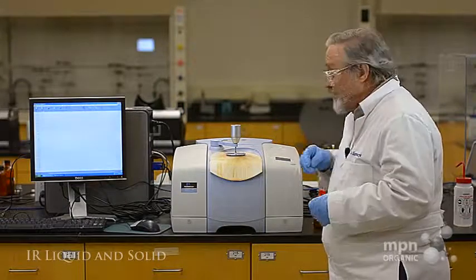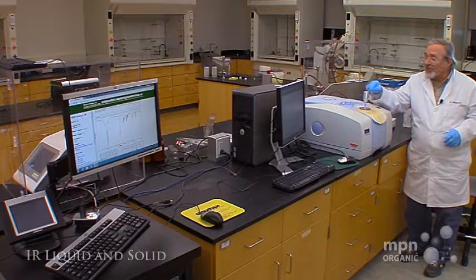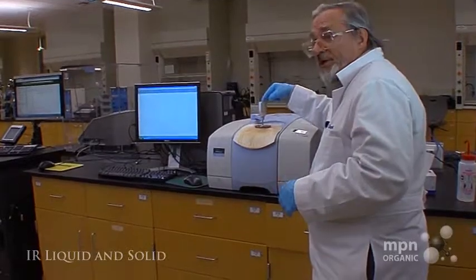Just like that. You can't feel it from the video, but we'll show you how to do that. So with a solid, you're going to be using this particular arm.